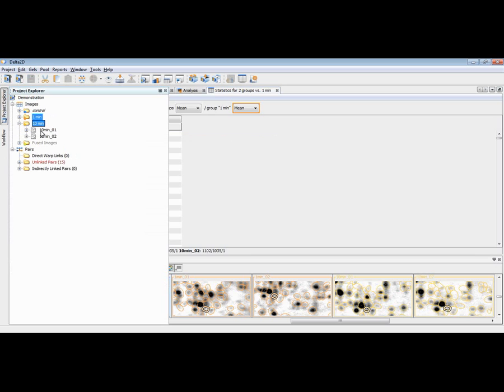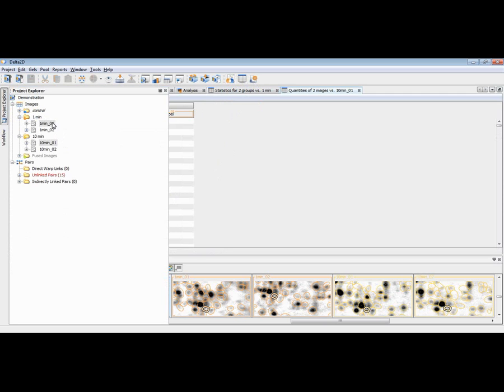You can also show single image tables if you want to compare this 10-minute image with this 1-minute image, and then press the quantitation table symbol again. You will get a table for these single image values. The rule for what kind of table you will get, whether a statistics table with group values or with values for single images, is that if you click on at least one image rather than a group, you will get the single image table. If you just select groups, you will get a statistics table.